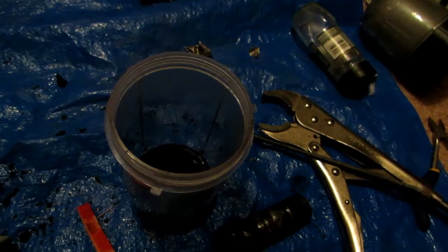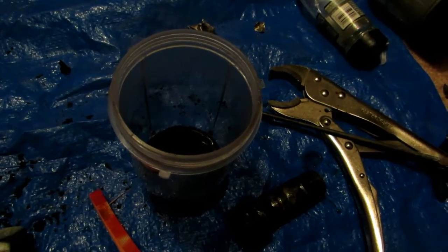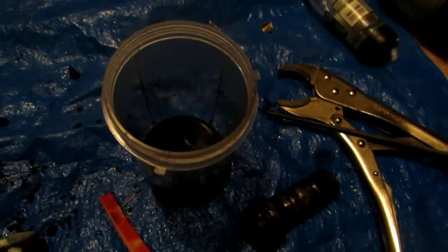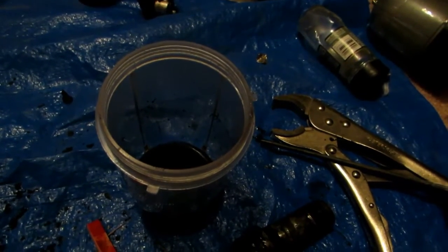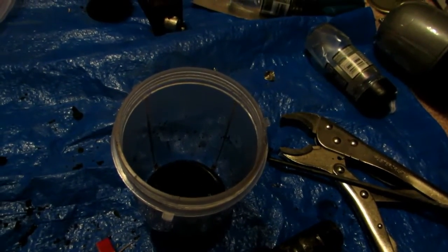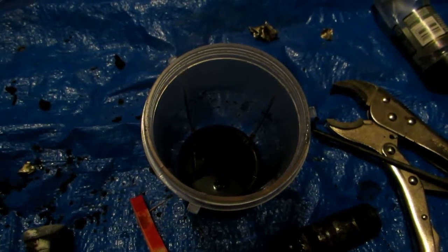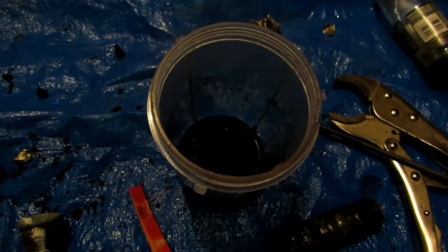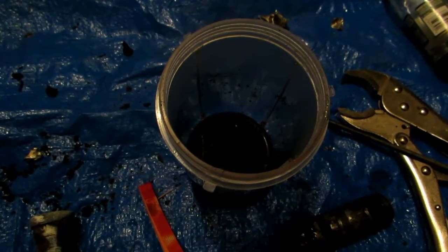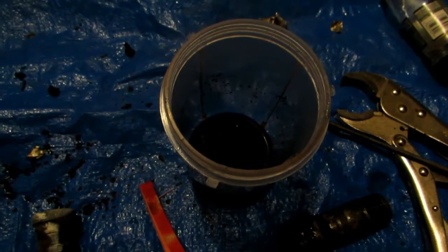There was a lot less black material than expected. Our apparatus didn't get hot enough to decompose potassium carbonate, so we shouldn't have been boiling any off. Perhaps the cream of tartar doesn't actually contain that much potassium, which could explain the lower yield. In a future attempt, I might simply heat it up with a blowtorch until it decomposes directly, as that'll probably be easier and less energy intensive. The black material here is hopefully just elemental carbon, which we can filter off.